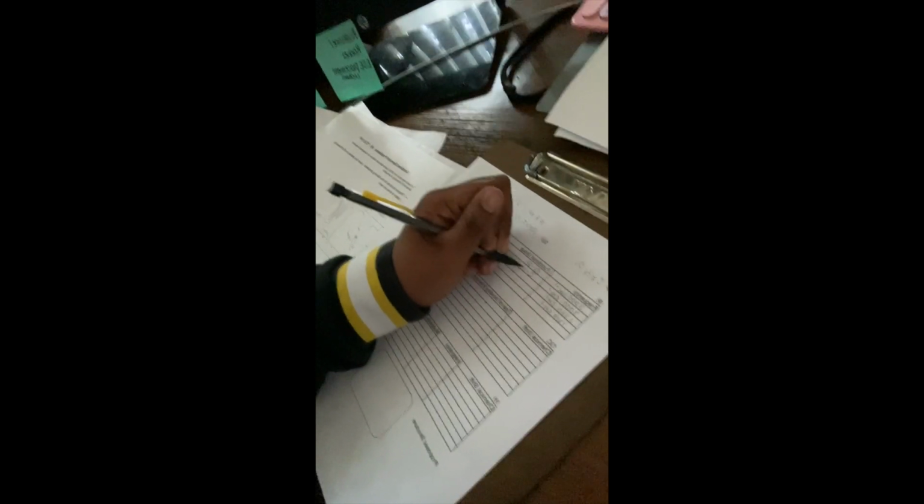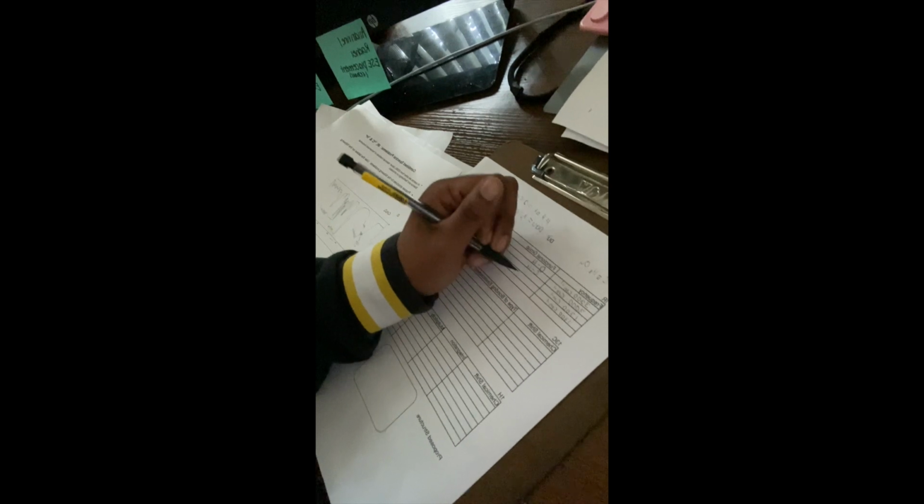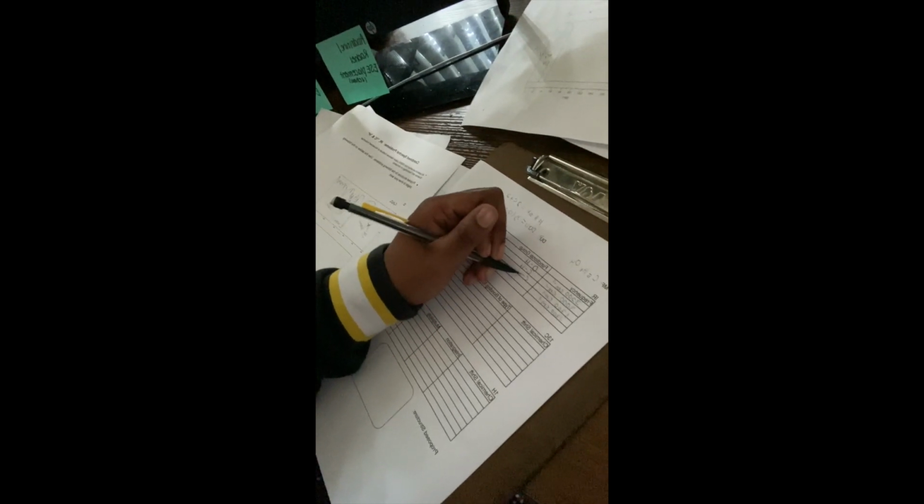So I've kind of memorized the main ones. So I know that 3,000 is going to be CH. I know that 1,700 is going to be, I believe it's C double bond O, and 1,300 is CH again. It's odd because sometimes there's an overlap in what you'll see in one frequency, another frequency. This is going to be very important for the end of our graph and in what we propose for the structure. I then move on to the next table, which is the 13C NMR.